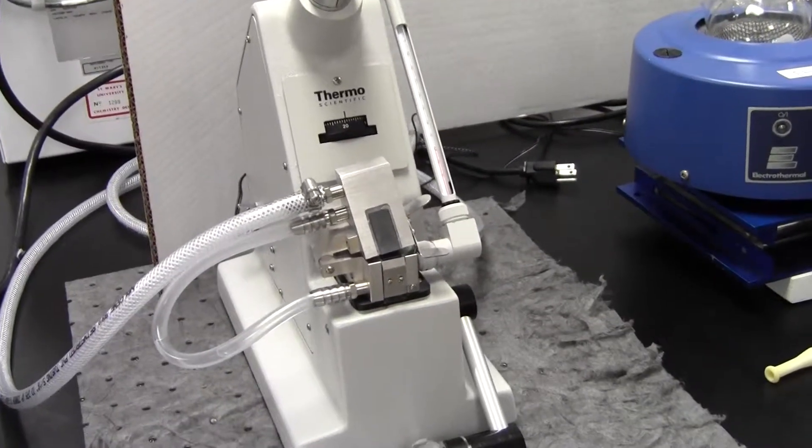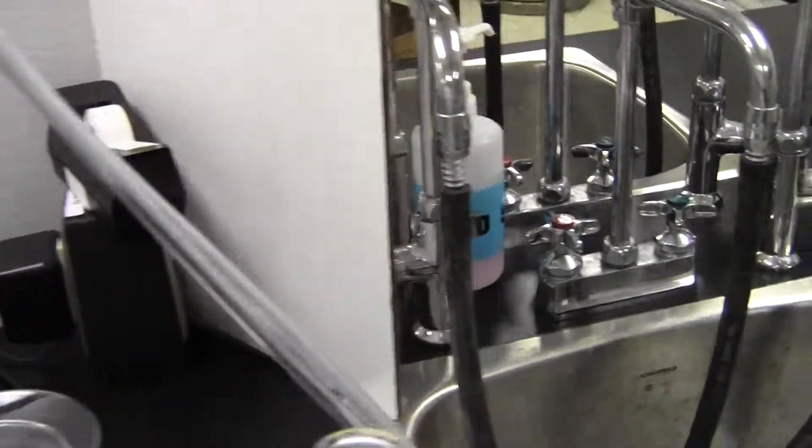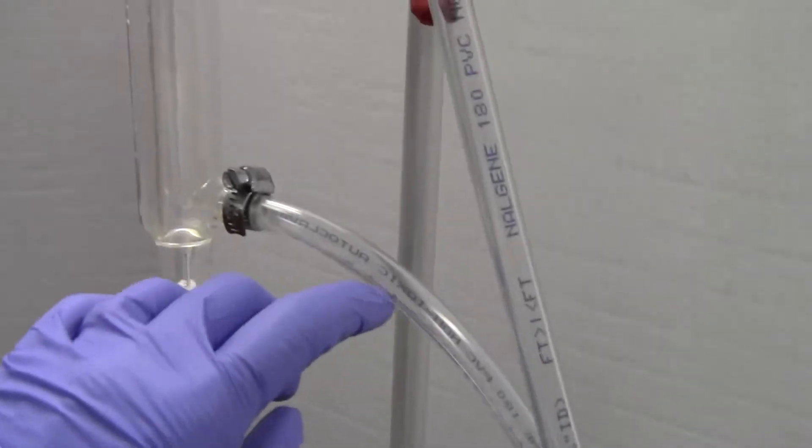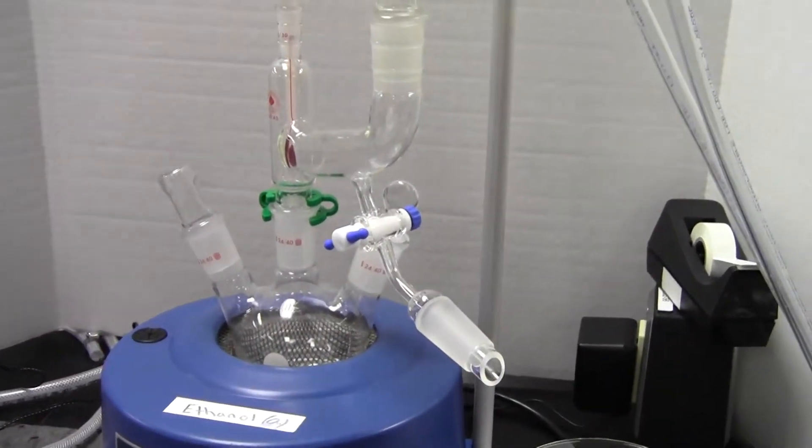As a last pointer, make sure that when you come in, the condensers are hooked up so that the water goes in the bottom and out the top, and that it's not splashing around but not on too fast. Have fun!